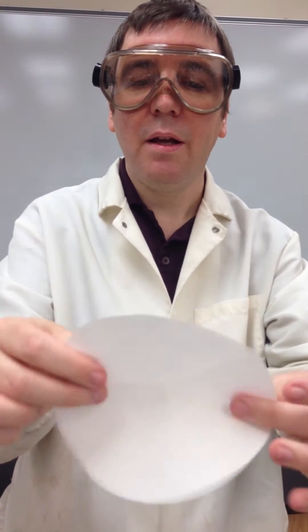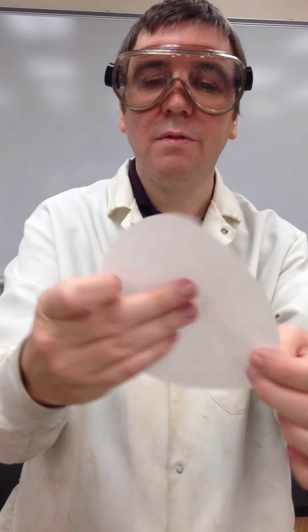I'm going to take this and fold it in half again, and fold it in half again.